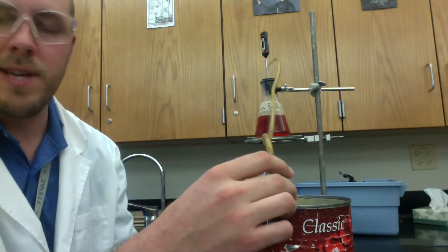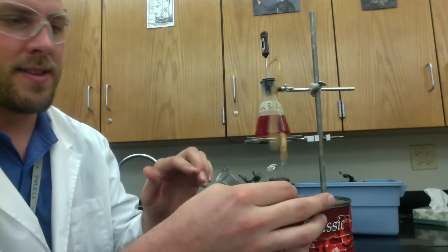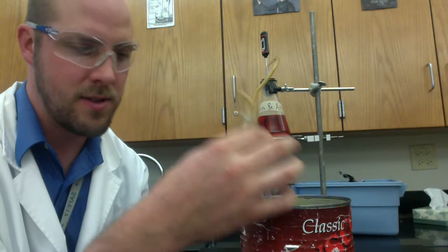So I had, like I said, a couple of groups every year that had nice beautiful distillation that had just their sugar left. And then they stuck this in here and it sucked a whole bunch of water all the way up to the top of the Erlenmeyer flask. So don't put it back in there.